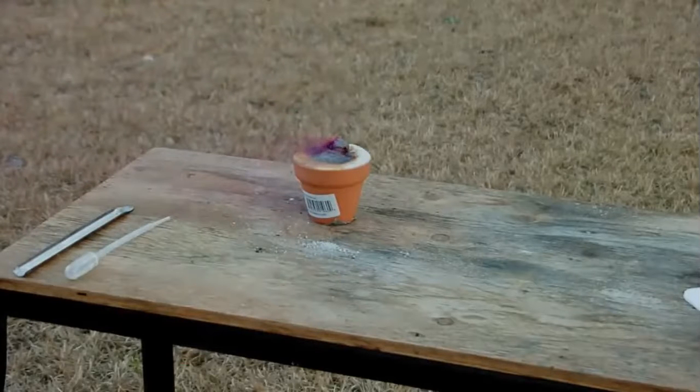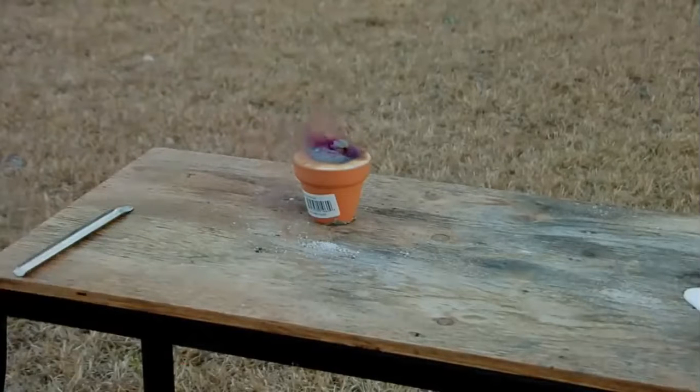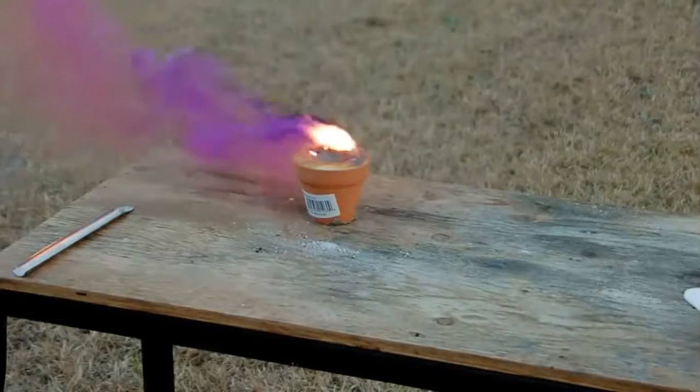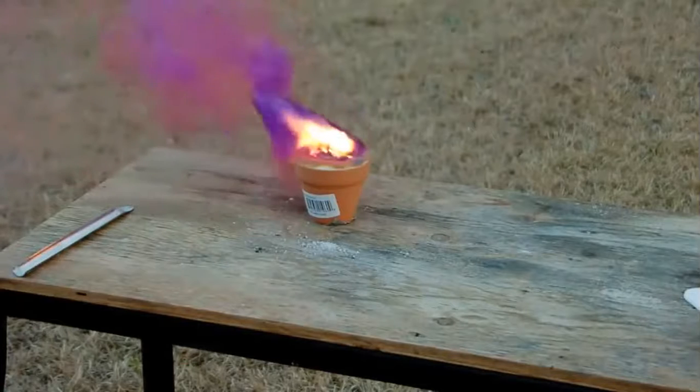You'll notice he's doing this reaction outside. In the classroom, we have to do it in the fume hood because this purple gas that's being produced is a byproduct. It's some iodine gas, and it's toxic. It could hurt you if you inhaled too much of it. So anytime you see a gas and it's got a color, that's a good warning sign to stay away. But we do this in the fume hood.